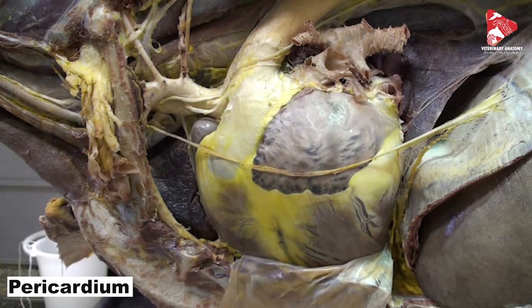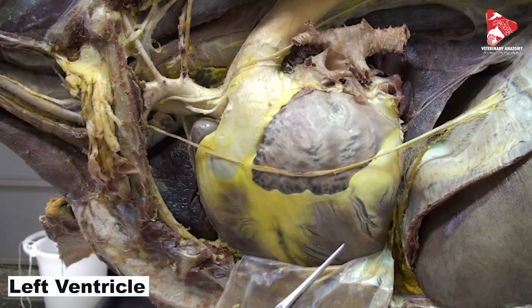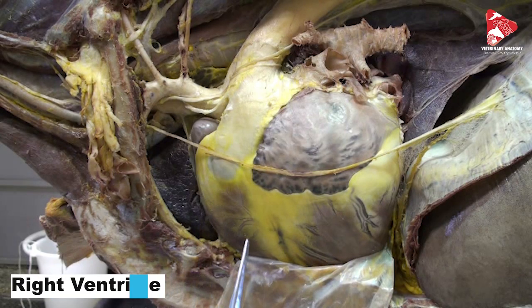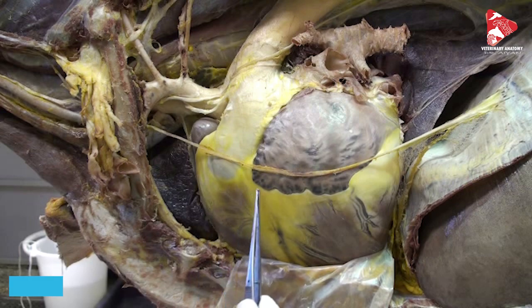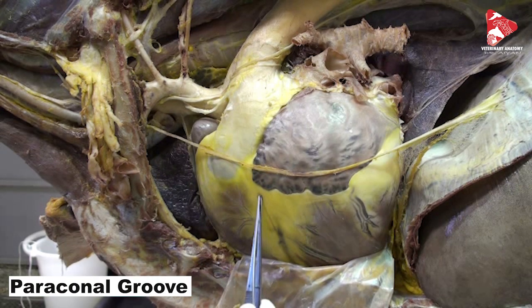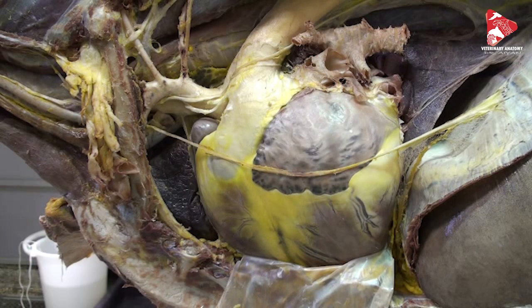We dissected the pericardium, the structure that surrounds the heart completely, and moved it to the side. Here we can see the left ventricle located caudally, while the right ventricle is located cranially. Between them we have the paraconal groove, also called the left interventricular groove.